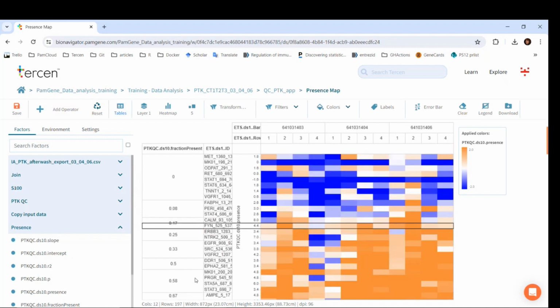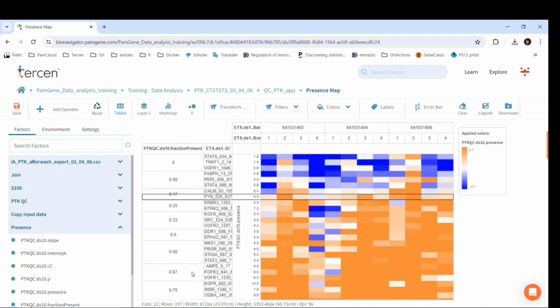Importantly, this threshold of 25% is based on an experiment with 4 conditions, since 25% is one condition, and there is a chance that all the not present values belong to one condition. So this threshold allows us to keep only those peptides which are present in more than one condition. Therefore, we should always revise this threshold based on the experiment. For example, if there are more than 4 conditions, or if we would expect that there can be important peptides which show up in only one condition. For example, in an experiment with very potent inhibitors, the phosphorylation of some peptides could decrease to an extent that they would be only present in the control condition. But we would still be interested in them.